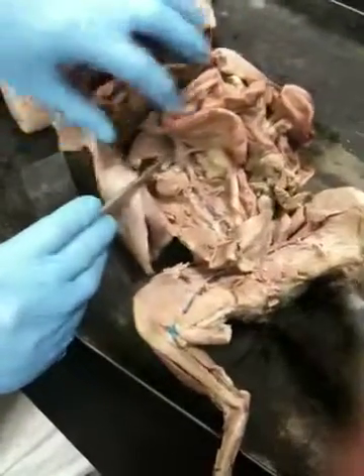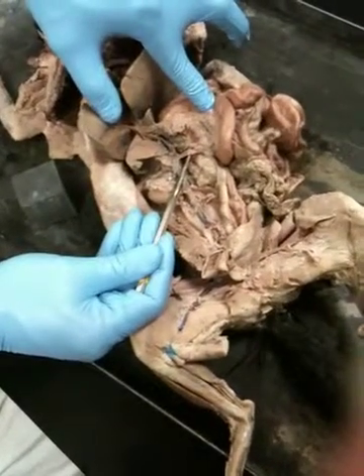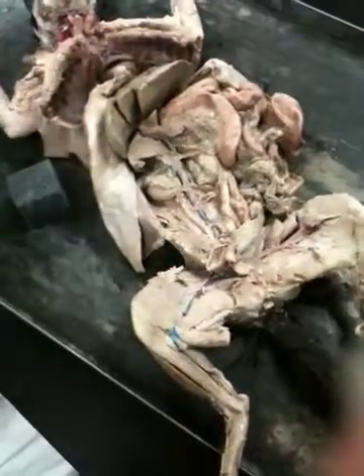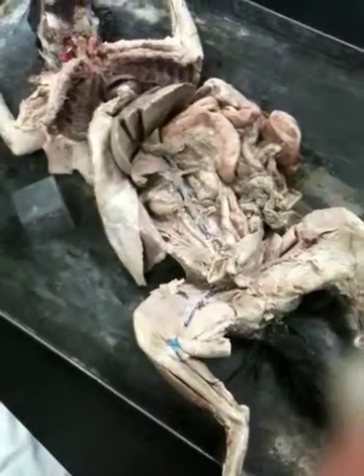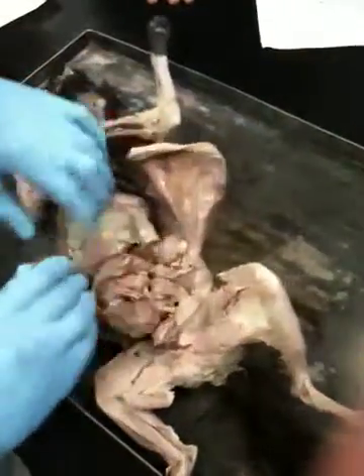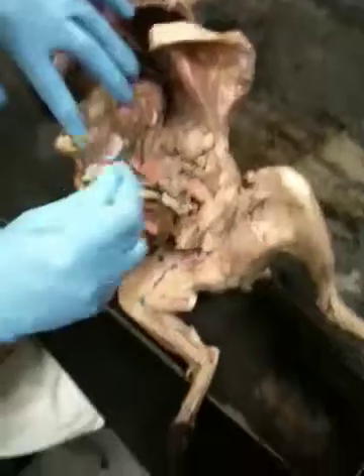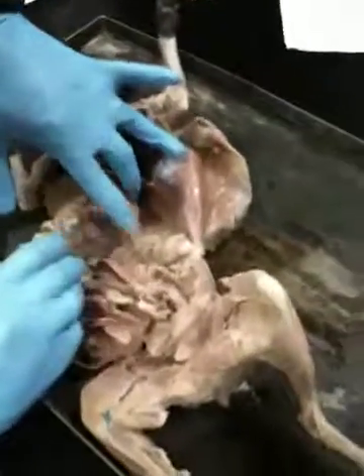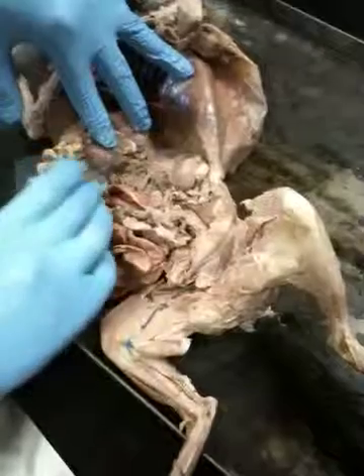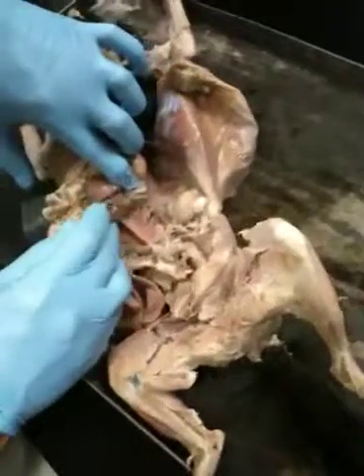On top of the kidneys, you should see the superior mesenteric, which is right here. That's superior mesenteric right there. Okay. On top of the superior mesenteric, you should be able to see the celiac trunk, which has the three separations and all that. So let's see if we can see it. Okay. So it looks like this one right there. You guys see it? Right there.